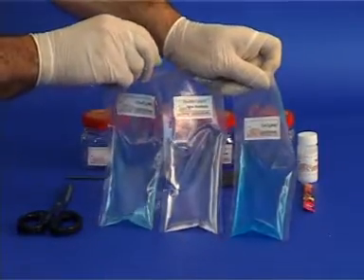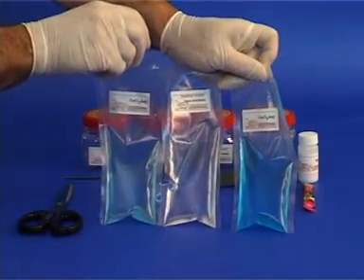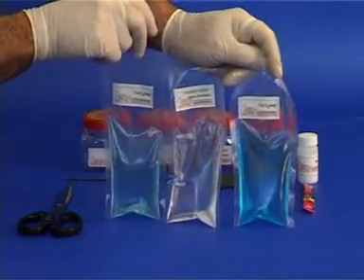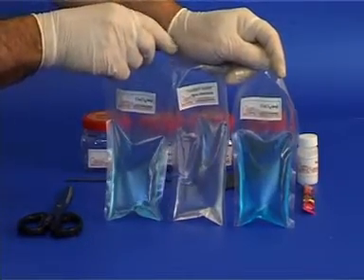The left bag contains dilute copper chloride solution, the right one contains concentrated copper chloride solution, and the middle one contains distilled water.